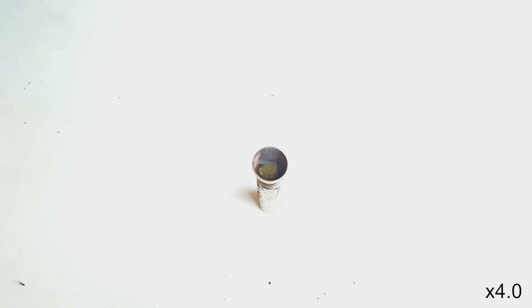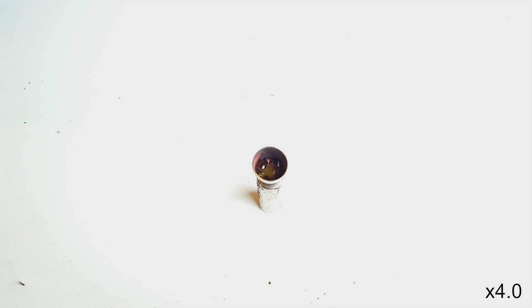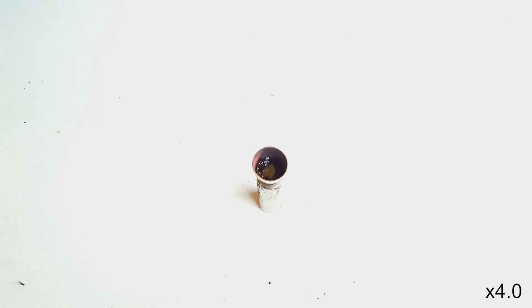Notice how there's no flames, no spectacular show, or anything really of the sort. The gummy just melts. The sodium and chlorine in sodium chloride are perfectly happy in their ionically bonded state and have no reason to react.